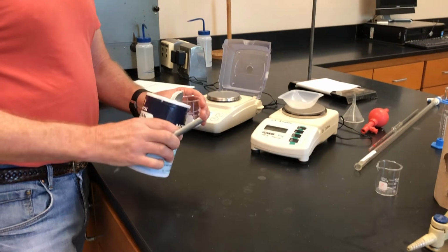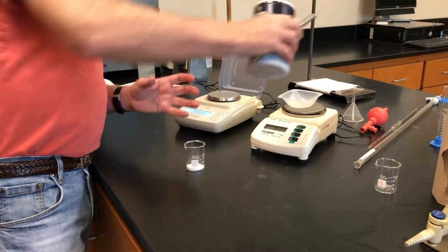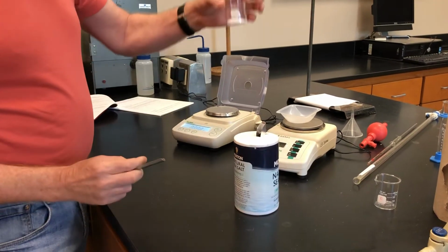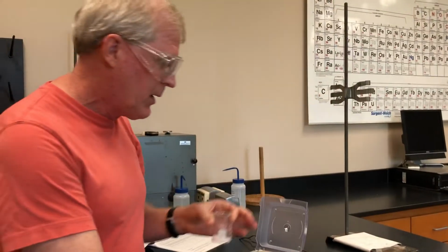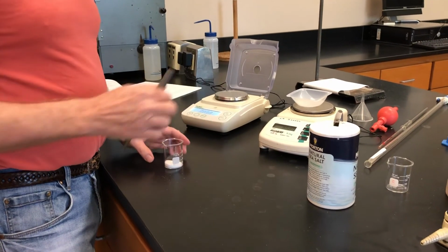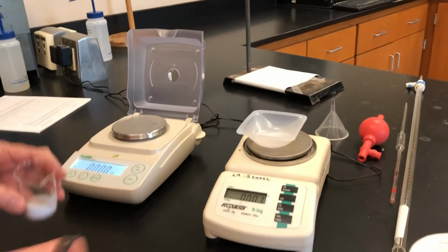And again, we're in Louisiana, so imagine if all the salt was clumped together and you start to pour it out, it's going to go pfft, and you're going to get way more than 0.5 grams of salt in there. I can tell you already that this is probably way more than 0.5 grams of salt. So anyway, this one here is finally starting to read 0 on the tare, so I'm good with that. So I'm going to weigh out 0.5 grams on here.